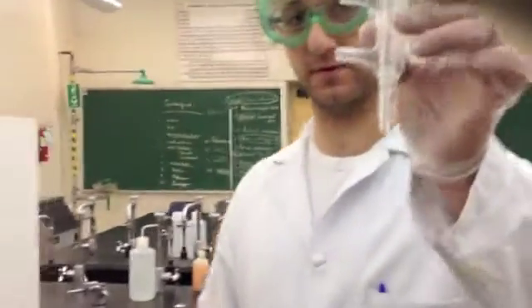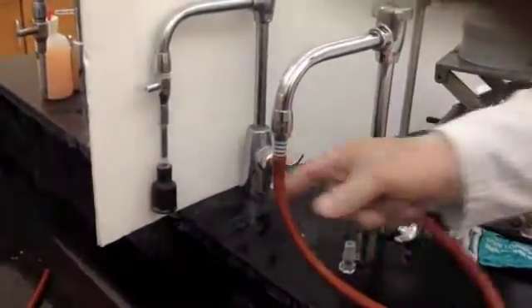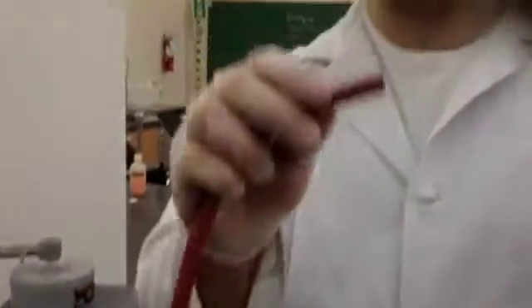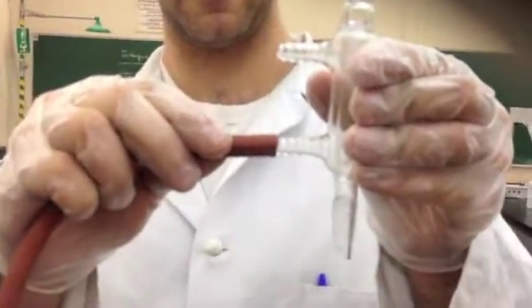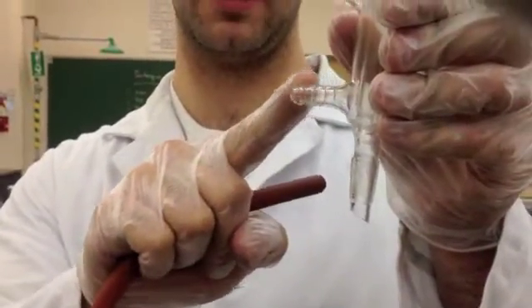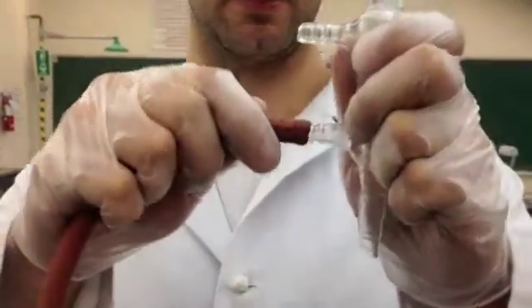This is the part where we connect the water jacket and condenser. This glassware right here. You need the tubing that will bring in the water already attached to the faucet. And this tubing will be fastened to the lower part of your water jacket and condenser's mouth.